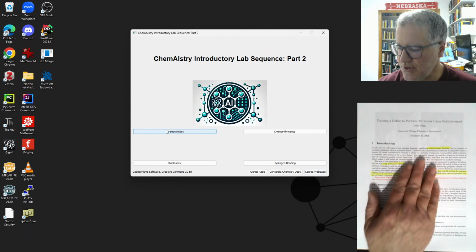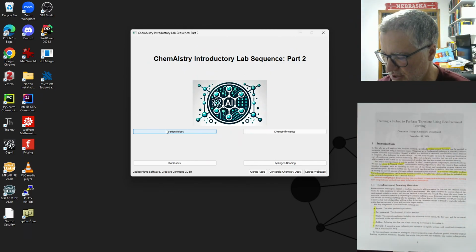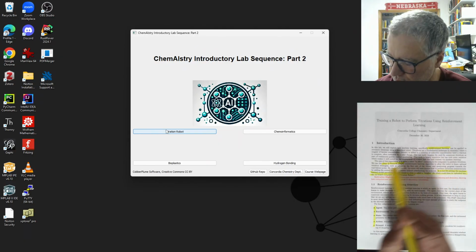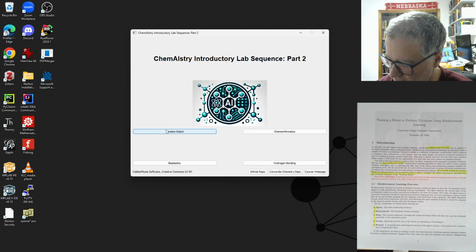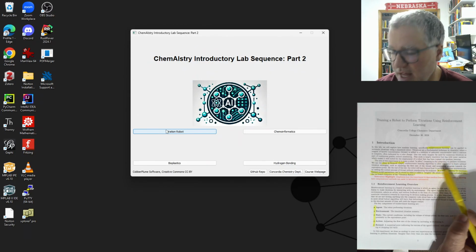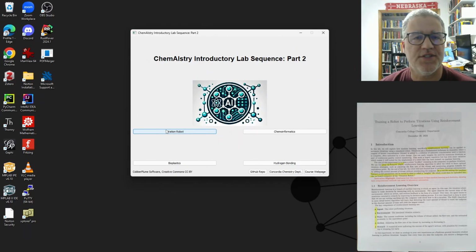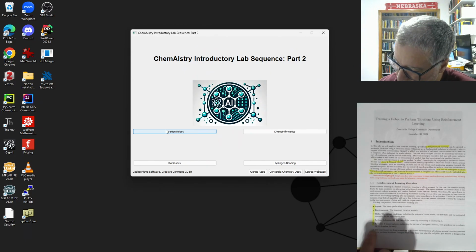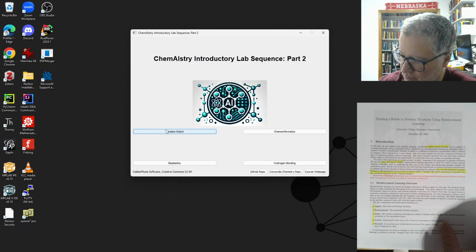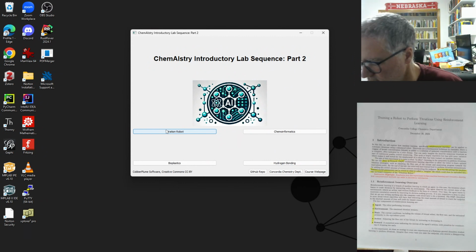This is from the manual, so we'll go kind of quickly through this because I talked about this on the board, but we'll be doing reinforcement learning with this DQN network. And what we're trying to do is train this so that in a real life scenario, you could set up the robot to do these titrations in, let's say, a quality control environment or something like that. Talked about the action, the environment, so you can look at that and sort of remind yourself of that, kind of keep track of what's what in this model.